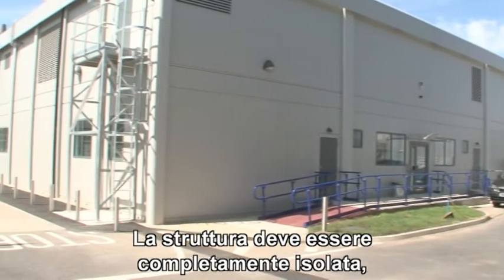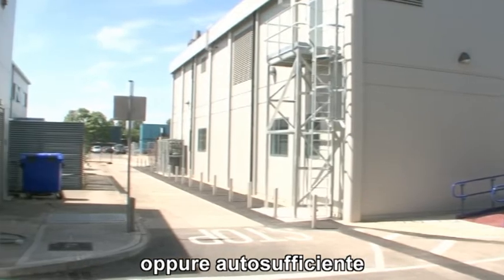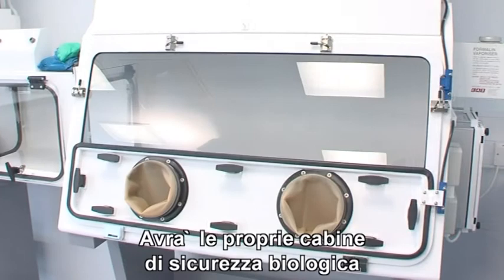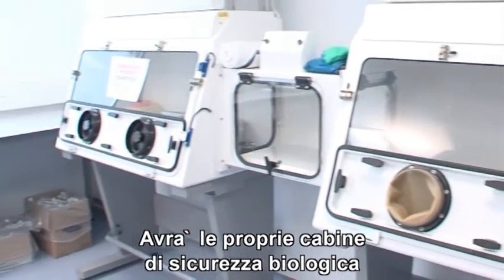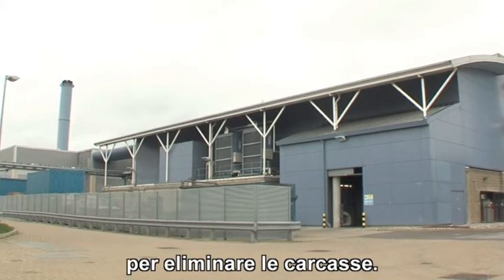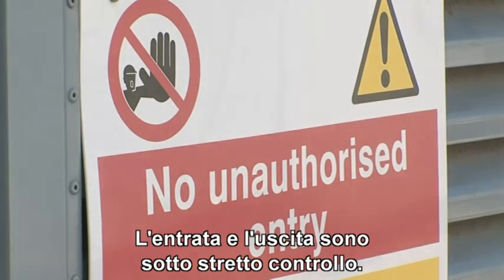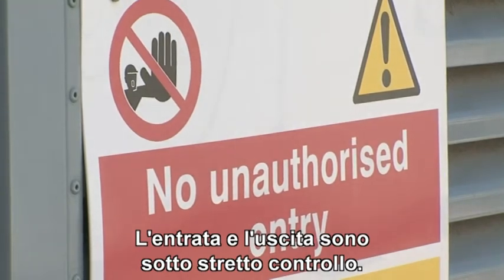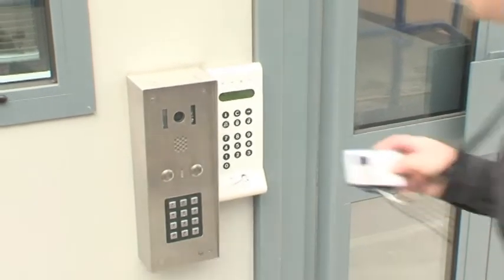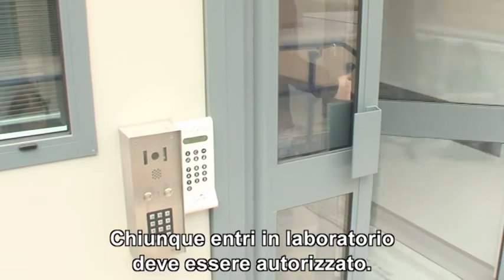The facility itself should be completely self-contained, either housed in its own building or set well apart from other working areas. It will house its own biological safety cabinets and other specialist equipment and have an incinerator on site for the disposal of animal carcasses. Entry to and exit from the lab is strictly controlled. Access is key activated. Any person entering the lab must be authorised and security cleared.